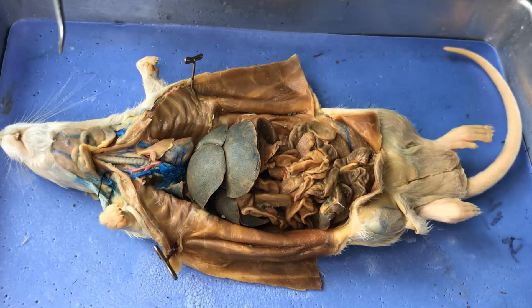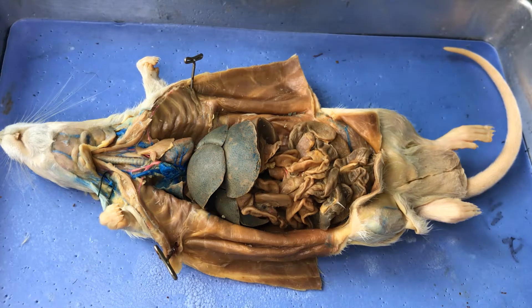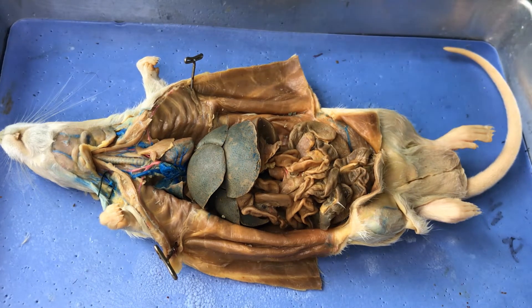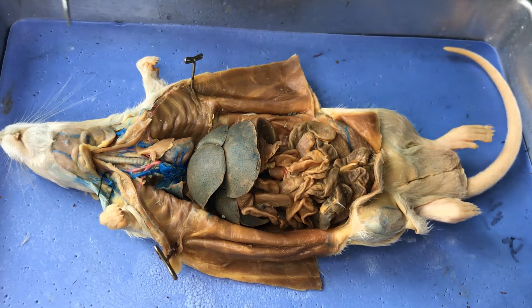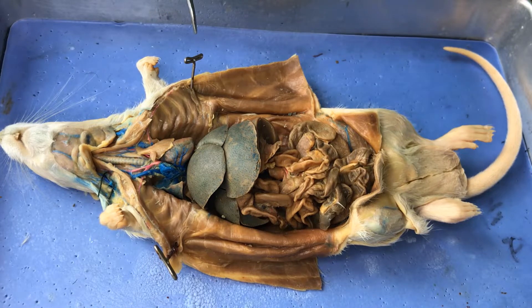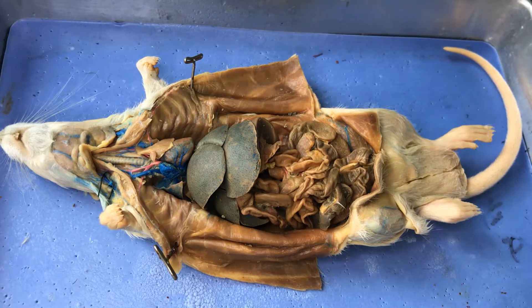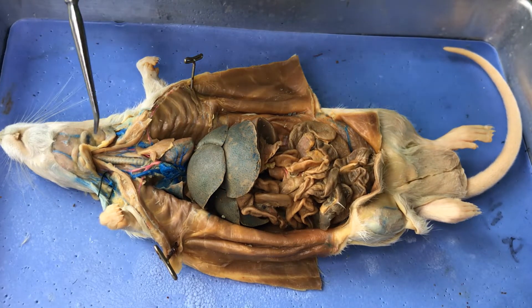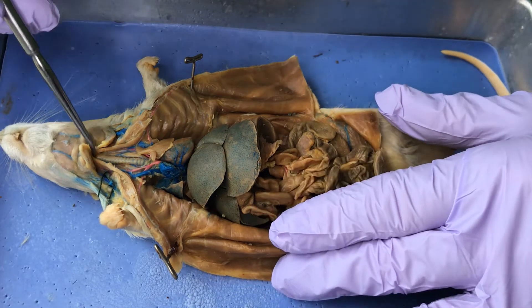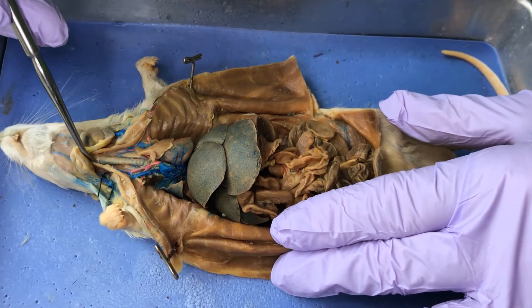This is the dissection of the endocrine system, and this is a male rat. I'm going to cover five different endocrine glands, starting up here. Here's the trachea — this is not a gland, that's the windpipe.